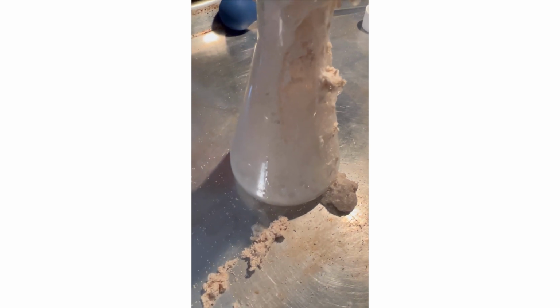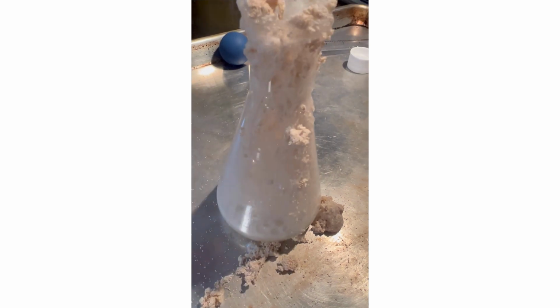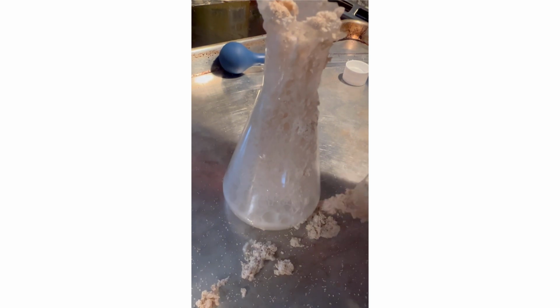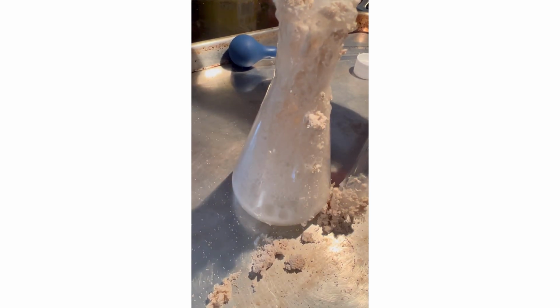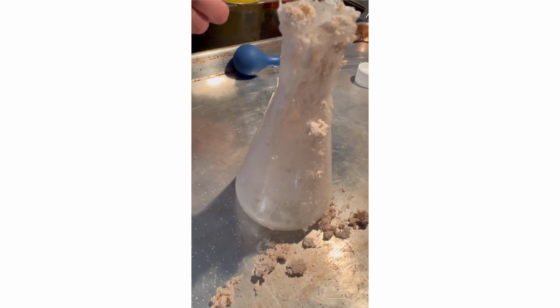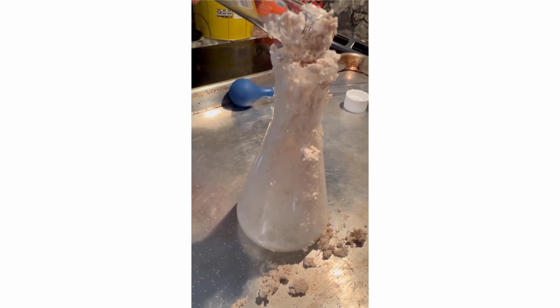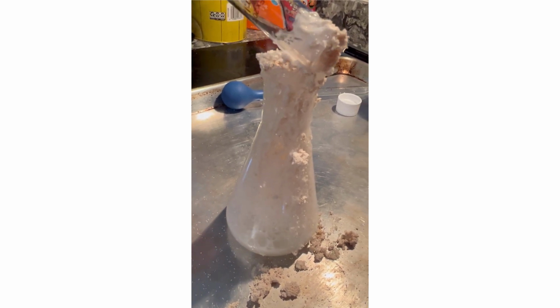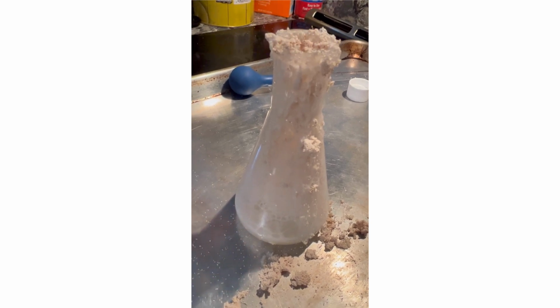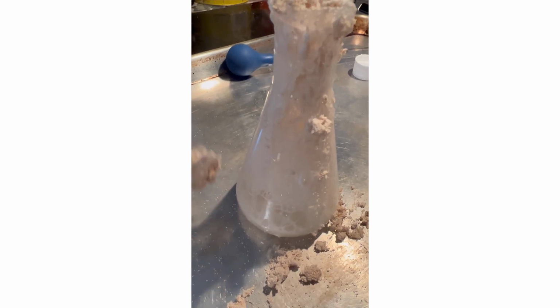It sent most of the yeast out. A very dense foam because of all that yeast. It just kind of dissolves into it and it makes this weird stuff. I think that happened because, well, there wasn't enough mixing and it just formed a layer on the top and it was pushed out.